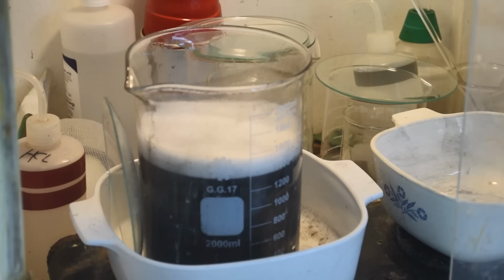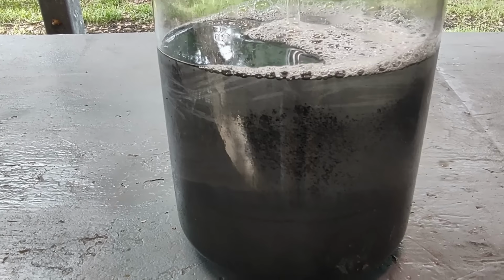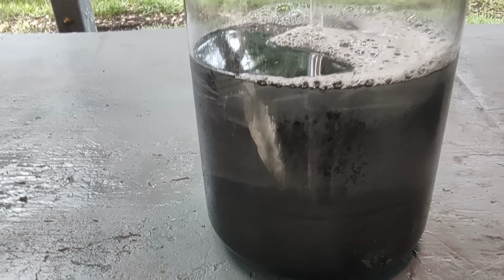But every time the foam comes up, it's full of palladium metal. So I think there's a lot of palladium metal in that beaker. So that's a good thing. Gonna let it continue to cool down and we'll see if it clarifies. If not, I'm gonna have to tempt fate to try boiling it again. Alright, this liquid is clearing up nicely. Even I don't feel the need to boil it again.